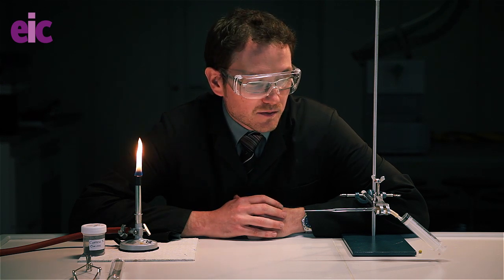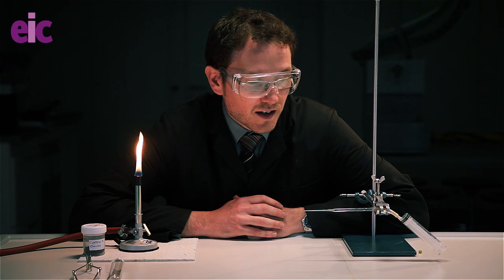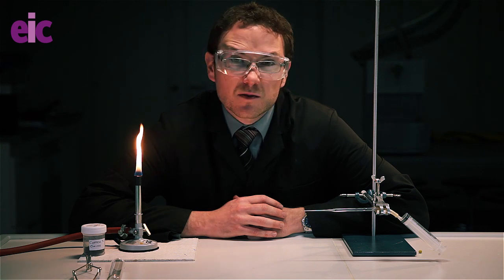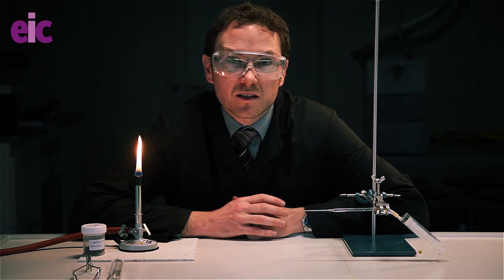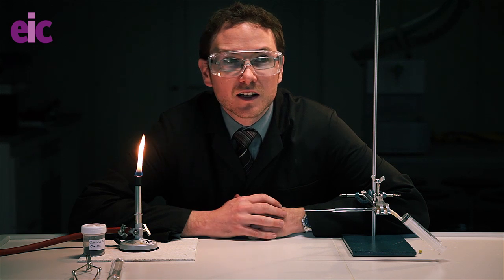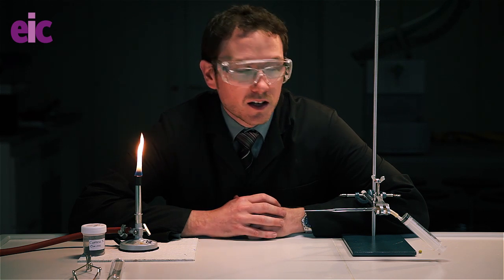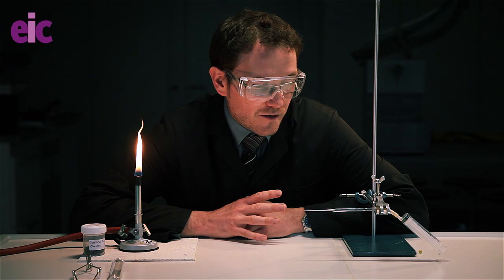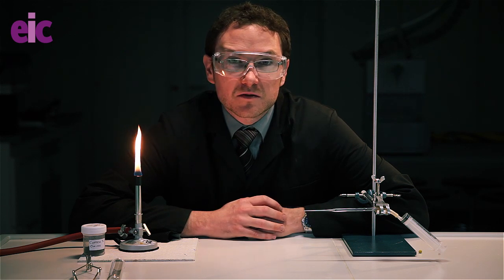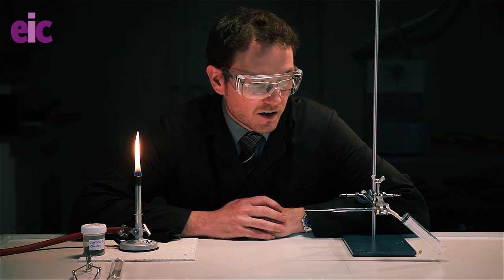So what we're going to be having a look at is a slightly micro-scale version of this. A lot of teachers immediately switch off when they hear the words micro-scale because they think it involves getting lots of specialist equipment, but everything that I'm actually going to be using here is just easily found lying around in the school.